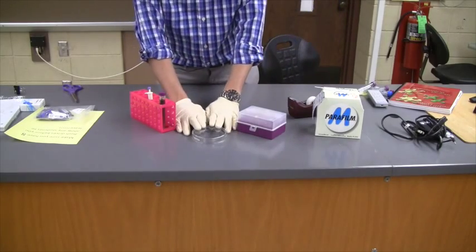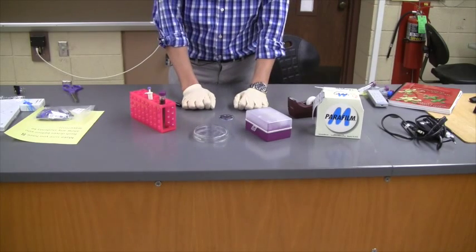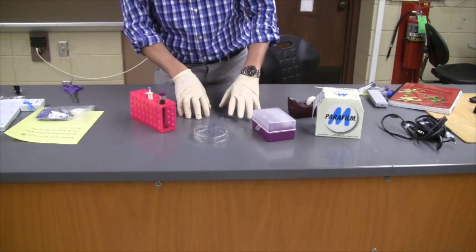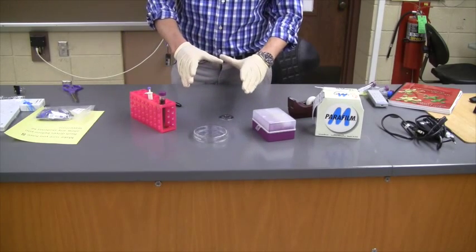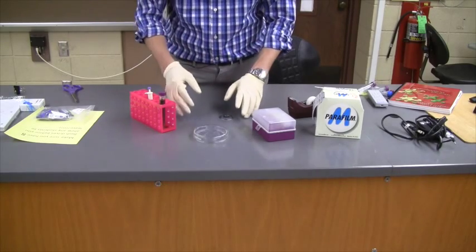Here is my petri dish. It does not have agar in it because I'm just using this one for demonstration purposes. When you come to lab during your lab time, you will get a petri dish with agar in it, and it's sort of a gelatin-like substance.